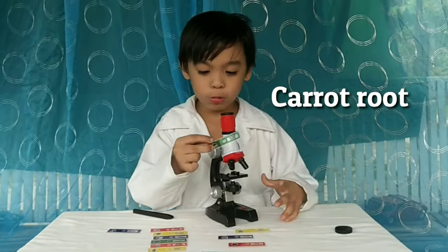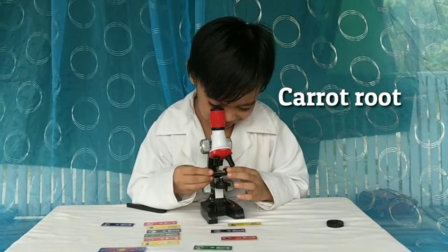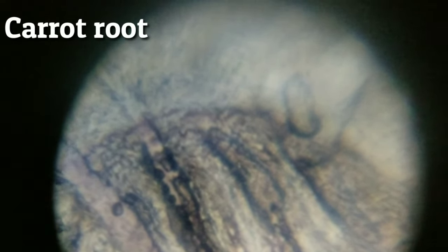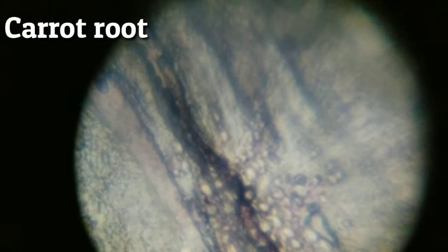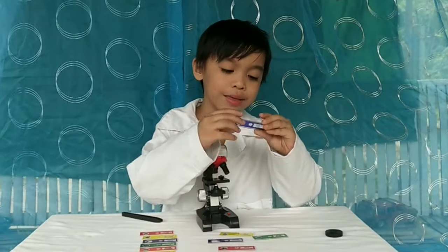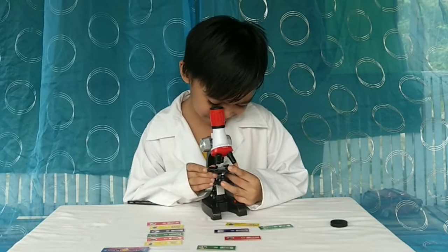Carrot roots! Here are purple and brown colors — many large and small circles. Next one is horse hair. Look at that hair! The hair is straight and black.